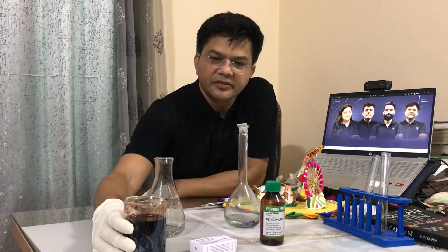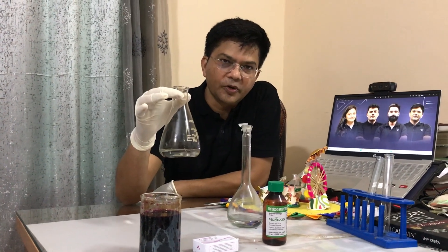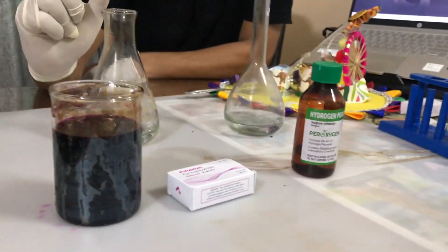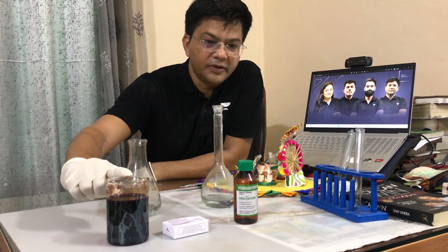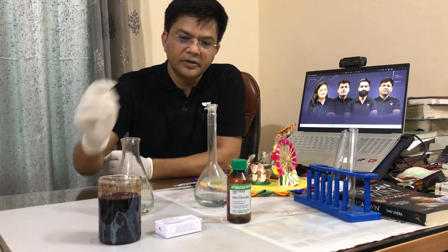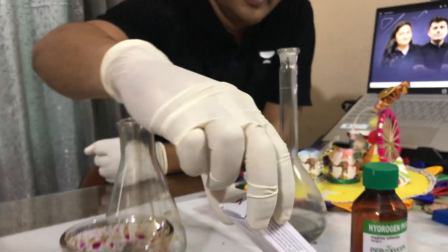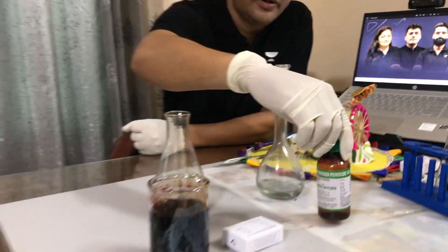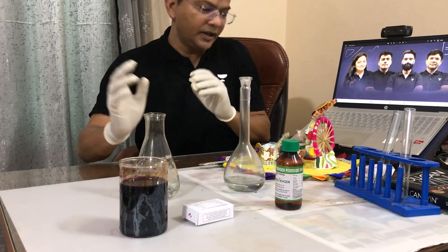This is KMnO4, and in this class there's hydrogen peroxide H2O2, so we are going to do a redox reaction. H2O2 can behave as both the oxidizing agent as well as reducing agent, but KMnO4 is a strong oxidizing agent. This KMnO4 is available in the market for 20 rupees, and this hydrogen peroxide is just 30 rupees.